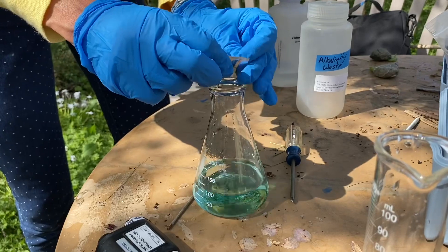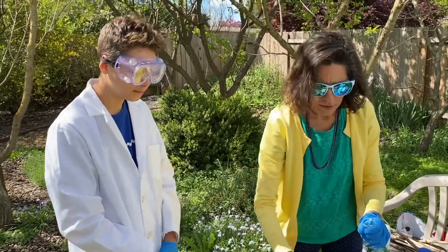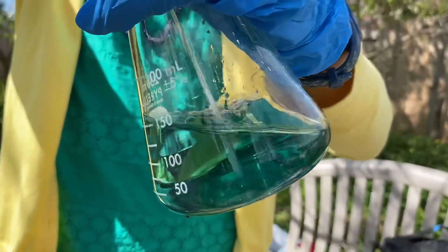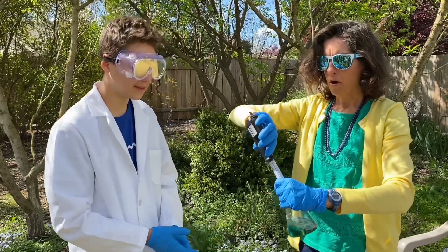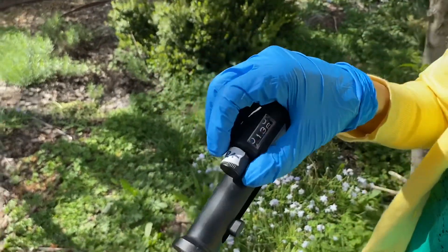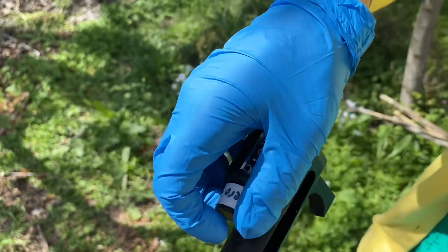You can see it's turning the water green. I'm back, and I got it nice and green now. So this is the color before you titrate, and we are going to titrate with 1.6 normal acid. See there's this little J hook — what we want to make sure is that the tip of the J hook is always in the water solution, and it helps to have two people.